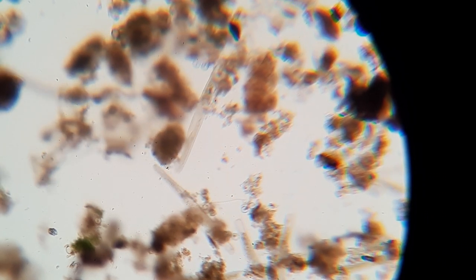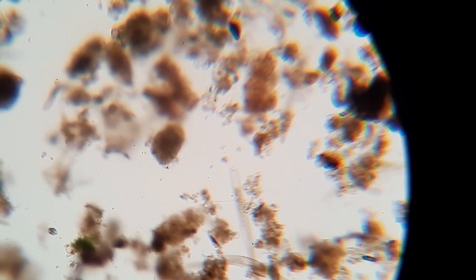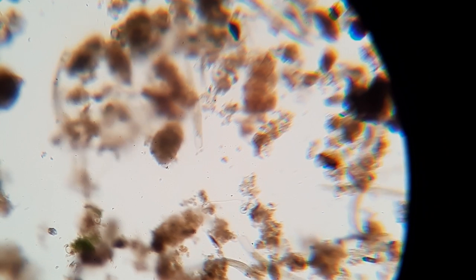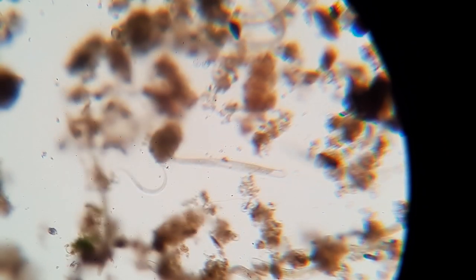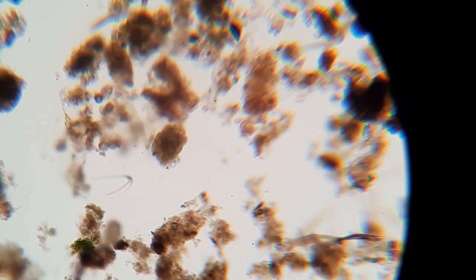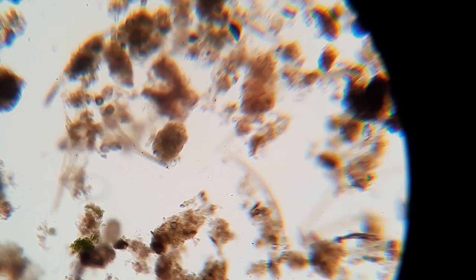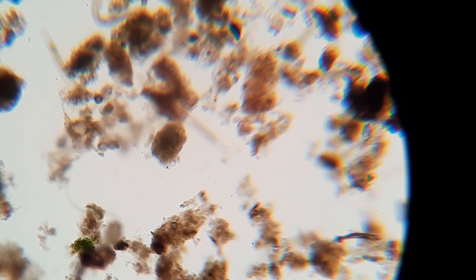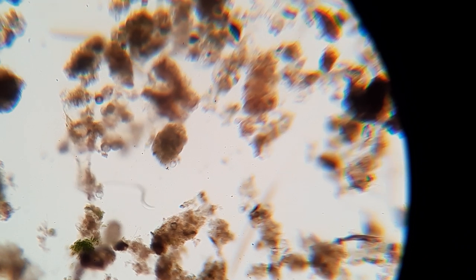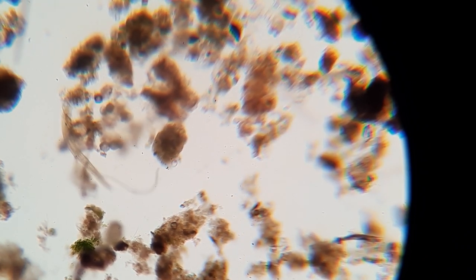I think it's from a shallow white dish that I originally had — a shallow white dish with two onion bottoms on it. I was trying to grow onion roots to get the onion root tip cells to see mitosis.